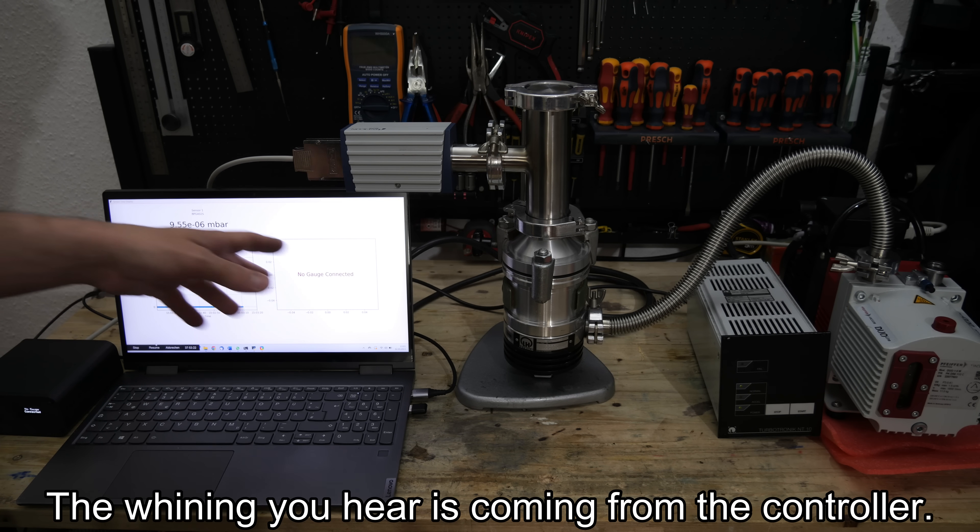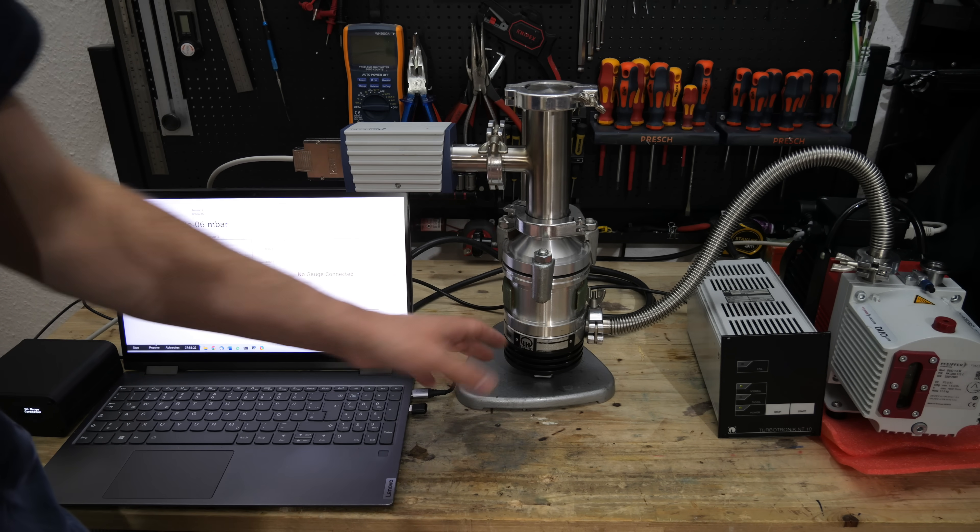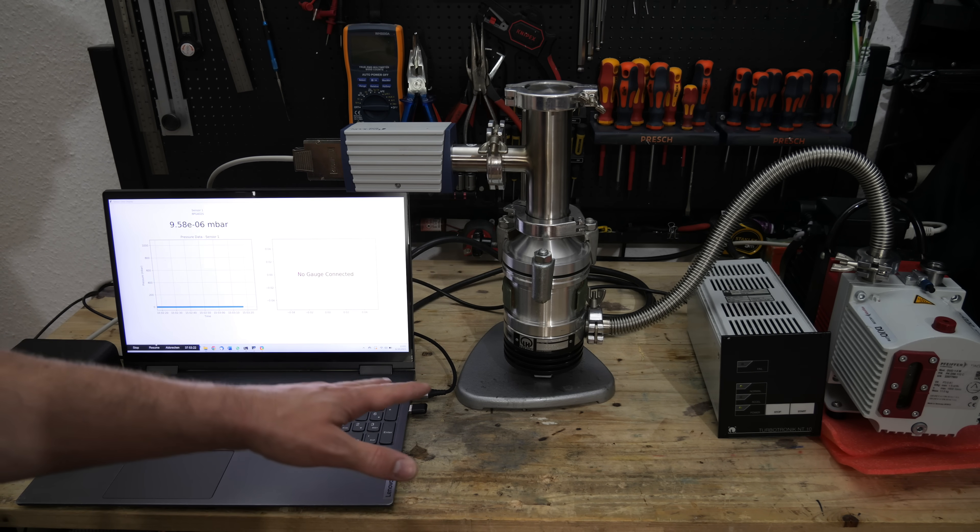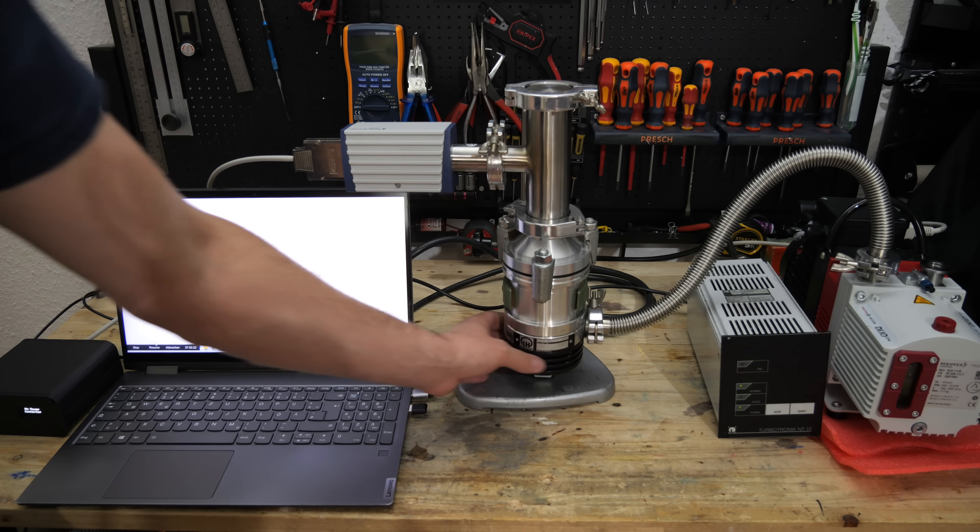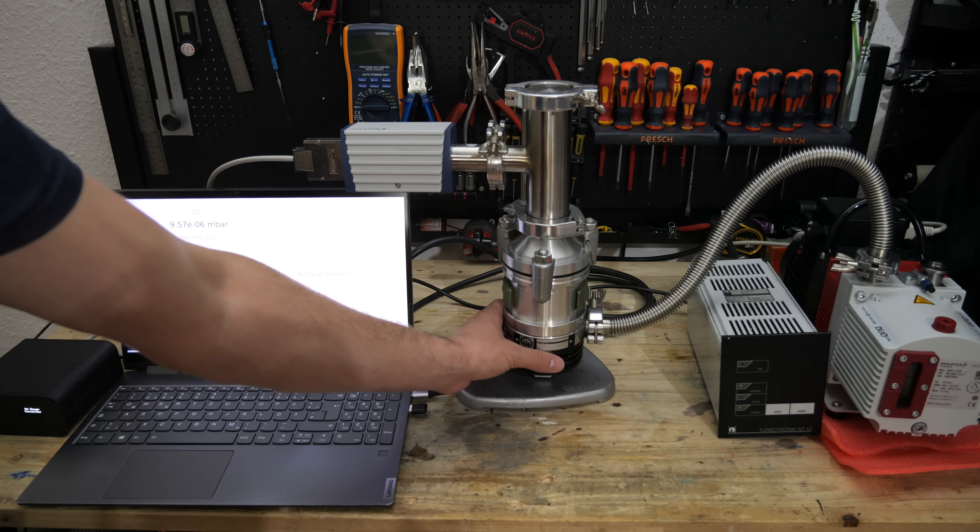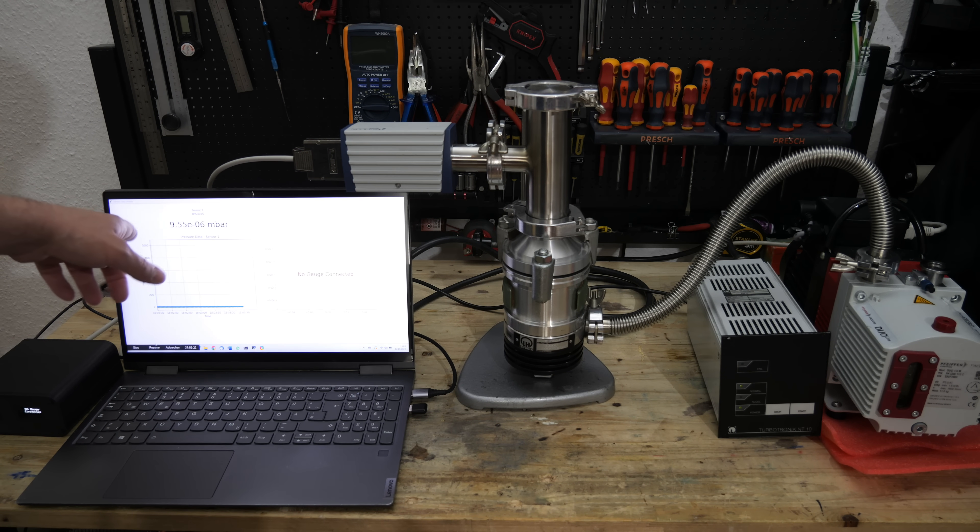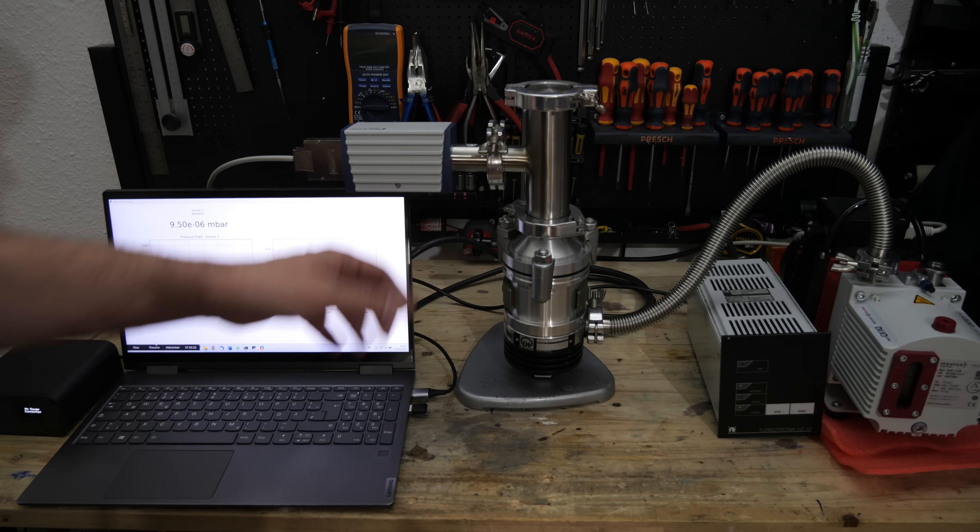Okay, it seems like the pump is running fine. I don't hear any weird noises. I don't want to leave it running for too long, because I don't have a fan installed currently, and I don't want the pump to get too hot. And that will be the next project probably. 3D printing a mount for a fan and installing a fan here. We've reached a pressure of 9.5 times 10 to the power of minus 6 millibars, which is I think okay.